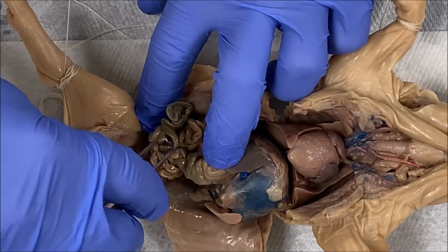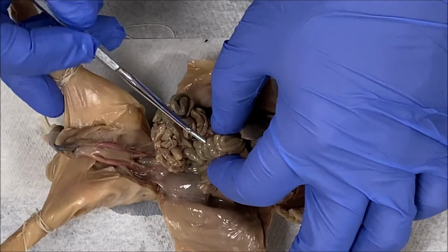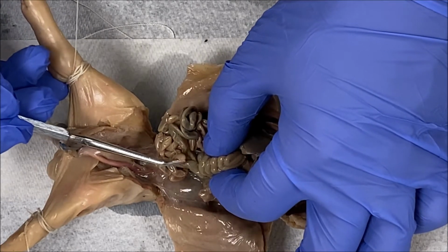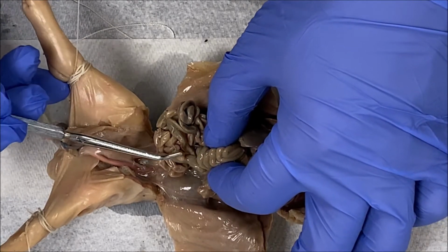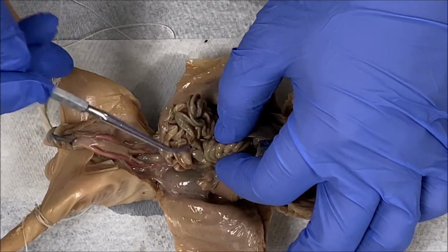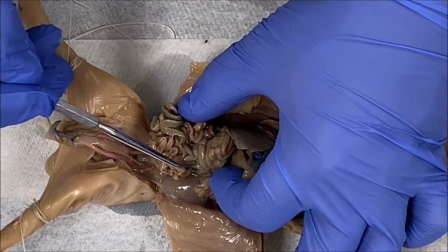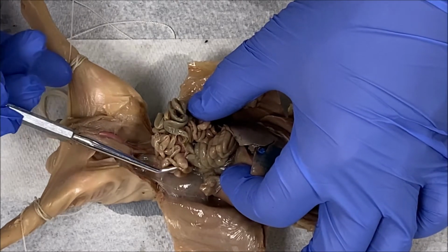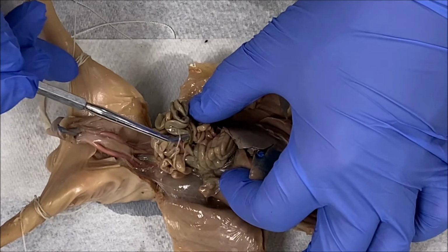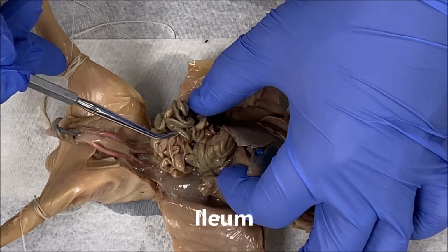I may have to use some forceps here to remove some connective tissue. But here's the large intestine right here. Here's the cecum, right? So this is that little blind pouch that you learned in your lecture notes. So here's the cecum, which is part of the large intestine, which means that just above the cecum, you have the part of the small intestine right here that attaches to the large intestine. So here's the large intestine. Here's the cecum, right, of the large intestine, and here is the small intestine that attaches to the large intestine. So this is called the ileum, okay?